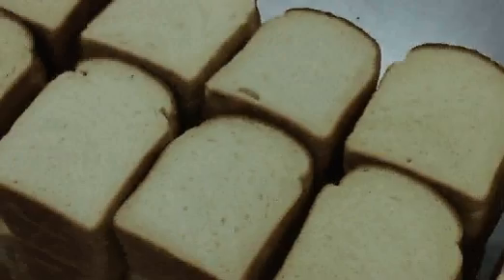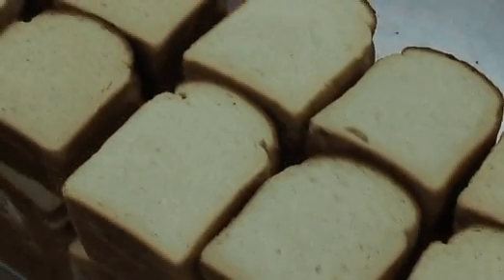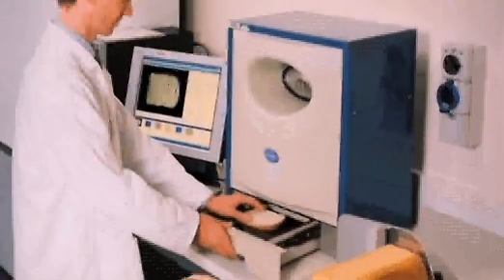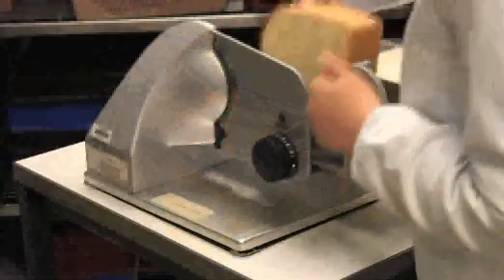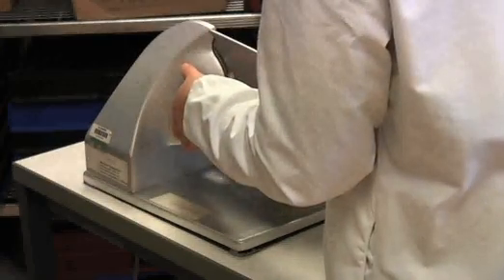One of the most important in recent years has been C-cell, an instrument based on image analysis which allows us to objectively characterise the individual structure of a given loaf. Loaves are sliced in a particular way using a rotary slicer to ensure a very, very flat upper surface.